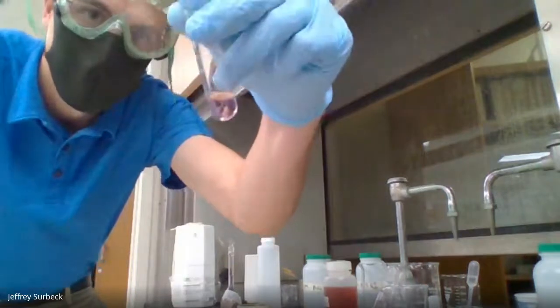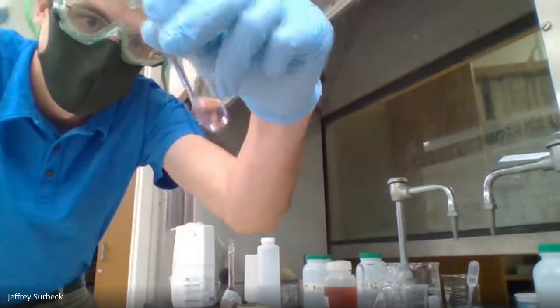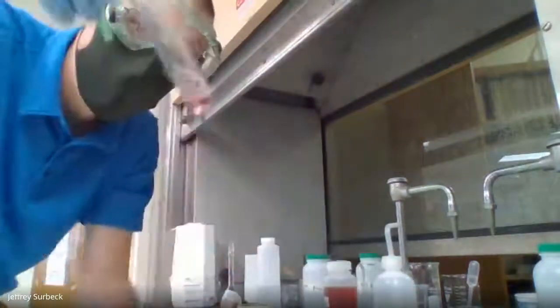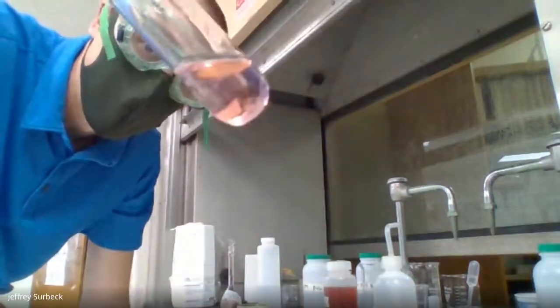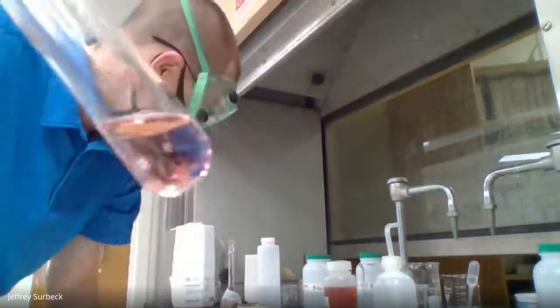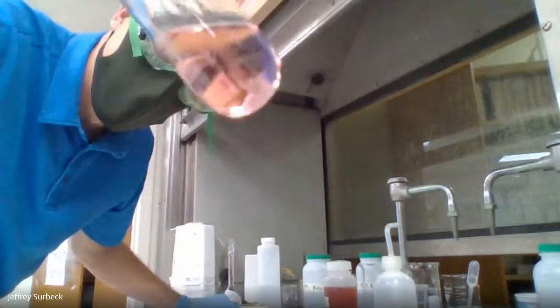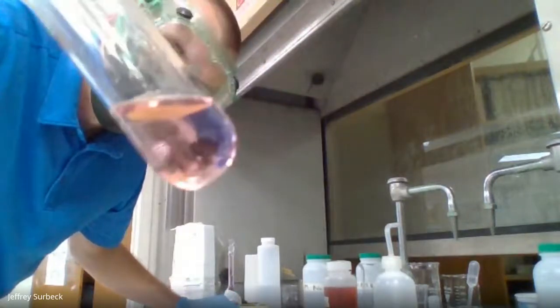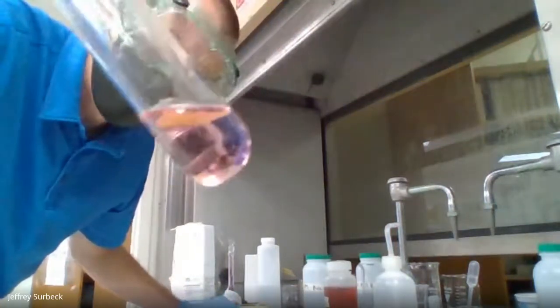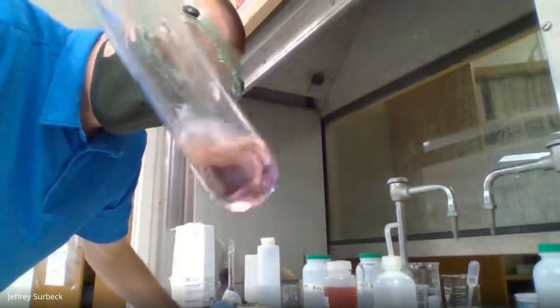Oh, cool. All right, so now just by adding water, we change this back to what we originally started with, this orange-red color. So this goes under number 10 in your report sheet. Okay, so we started this, we added concentrated acid, it went that blue-purple color, and then now we added water and we shifted our equilibrium back.